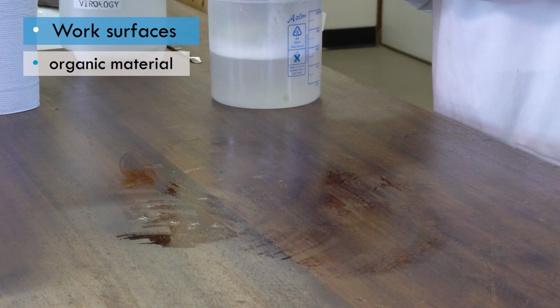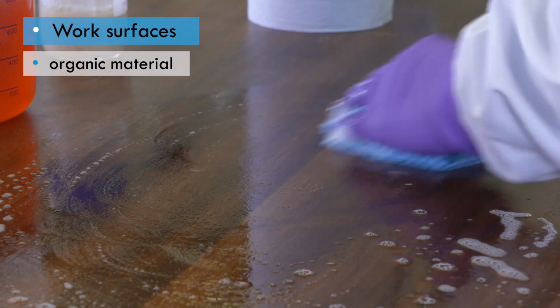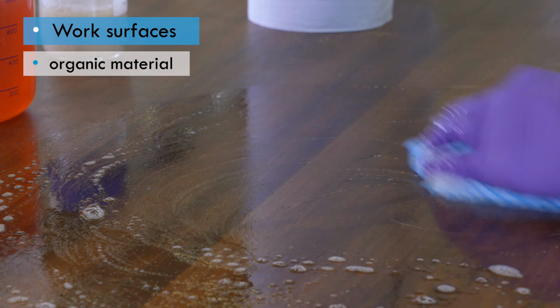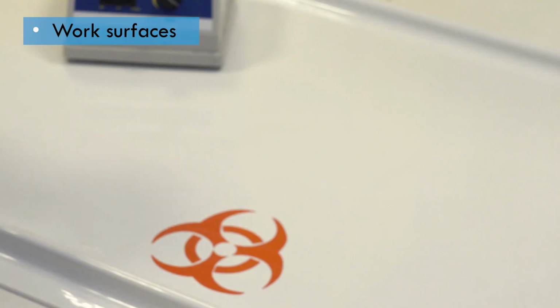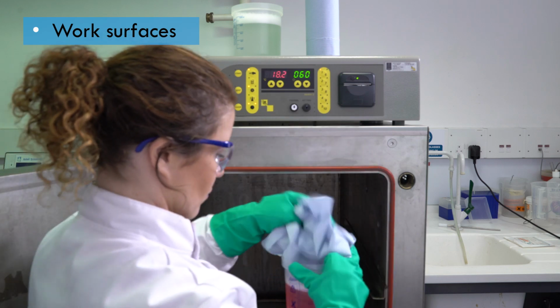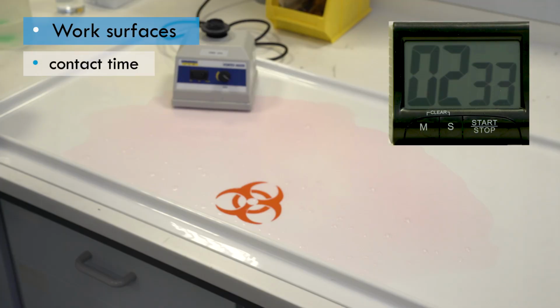If there is organic material or dried residue on the surface, it should be cleaned with warm soapy water to avoid inactivation of the disinfectant from high loads of organic material. Disinfectant can be applied to a surface either from a spray bottle, by pouring it carefully, or by transferring it to a disposable tissue or a cloth for wiping. The disinfectant must then be left for the required contact time.